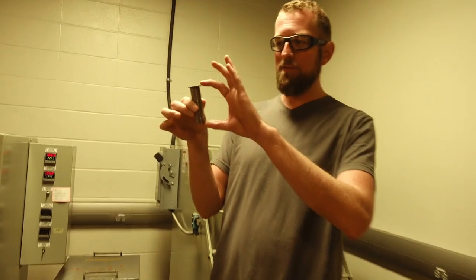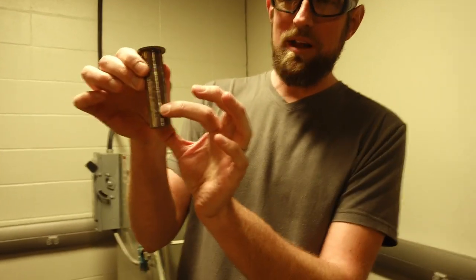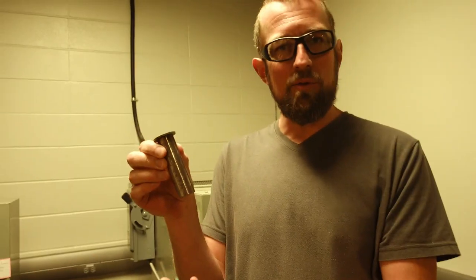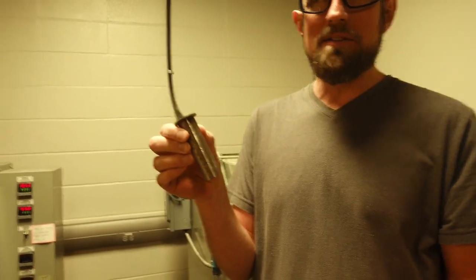So what are you going to do now? Let's do some Jominy testing. Here's my Jominy bar. This is a four inch long bar, one inch in diameter. This particular piece is made of AISI 1040 steel, plain carbon steel, 0.4% carbon. So like a pretty basic medium carbon steel that we're going to test here today.